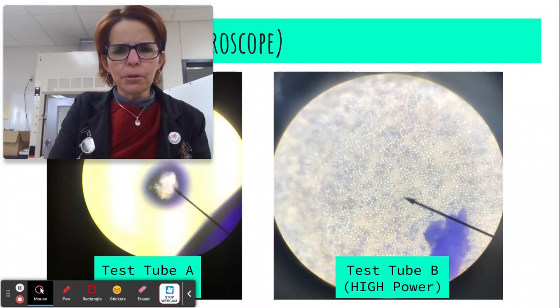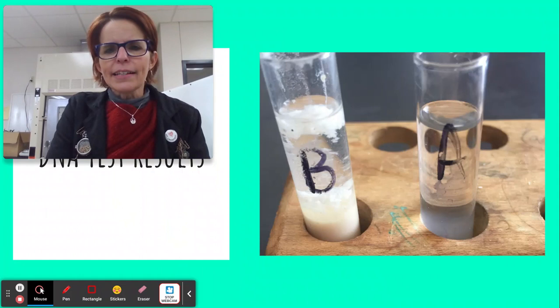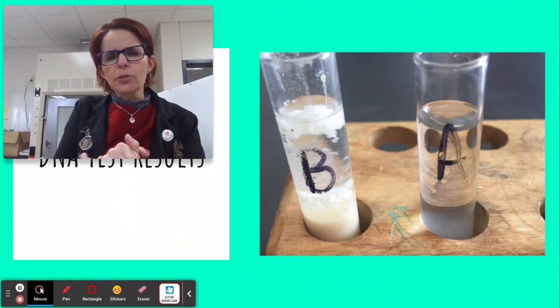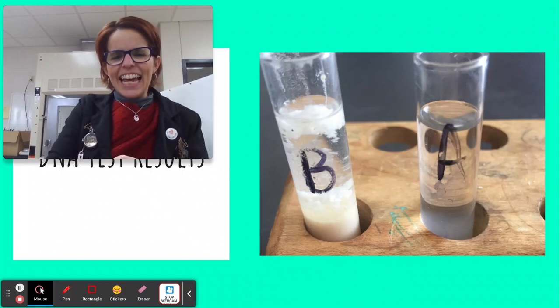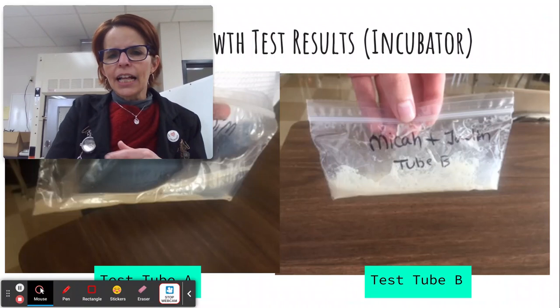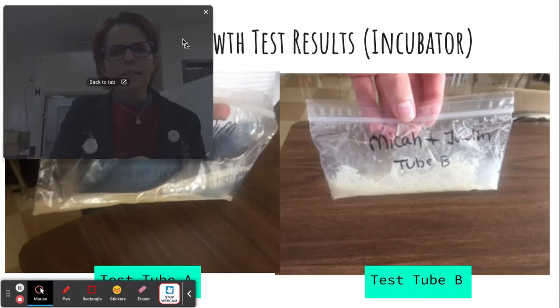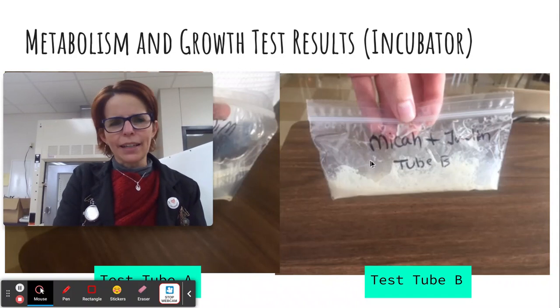Oh, and I was just going to show you a couple quick images on this. Hold on. Let me back up. This is the DNA if you wanted to see it up close. So there's B with some DNA, and then A had no DNA in it at all. And then obviously, whoops, the two bags. I'm going the wrong way, everybody. There we go. The two bags had, one was full of bubbles and one wasn't. So this baggie here was full of bubbles.